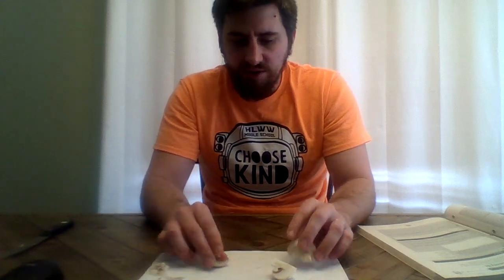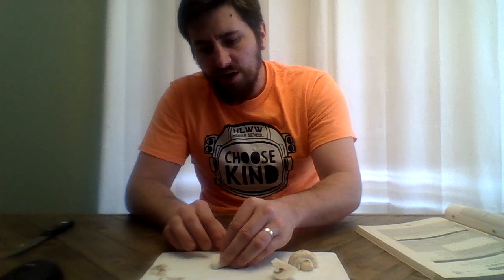I'm going to leave this. I heard if I leave this on a towel overnight, there'll be spore formation around it. And that is actually typically what scientists that study mushrooms use to identify mushrooms if they can.